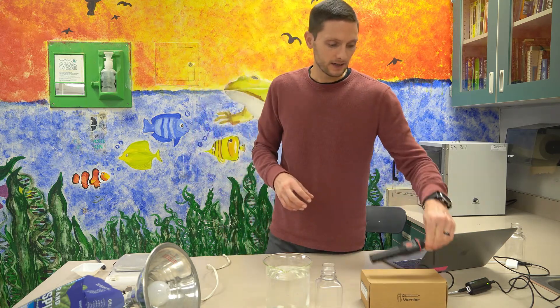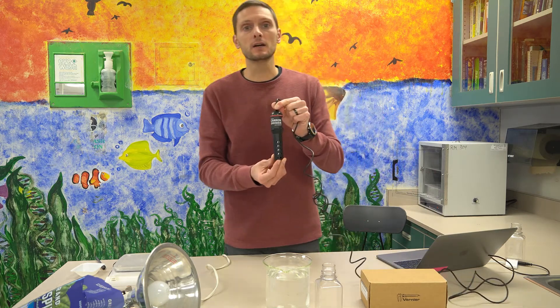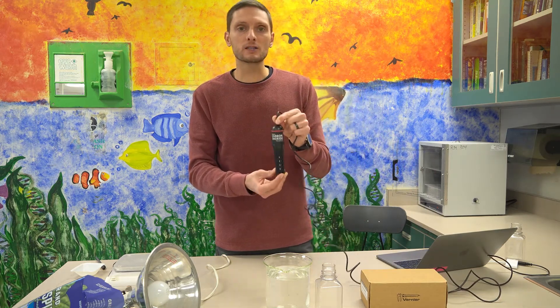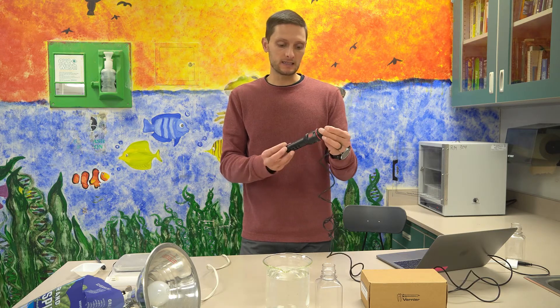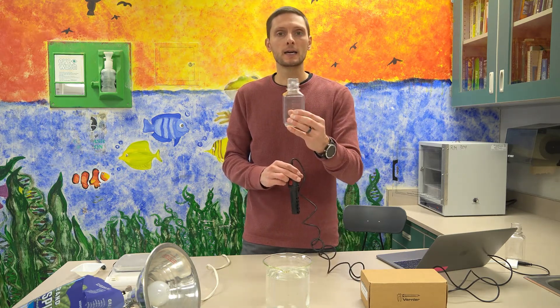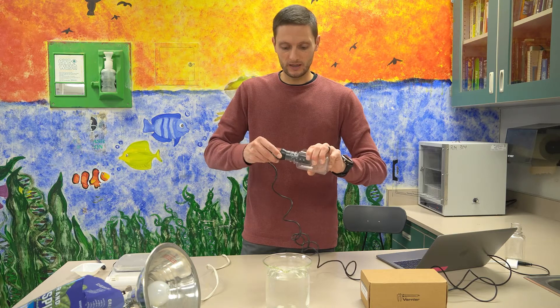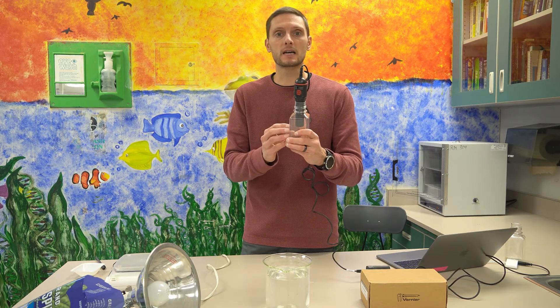We're also going to use a carbon dioxide sensor. And this sensor, much like the gas pressure sensor that I've used in the past, measures in a contained environment in this biochamber that we're going to use today. Once put in here, it creates a sealed environment and will measure the amount of carbon dioxide inside of this chamber.